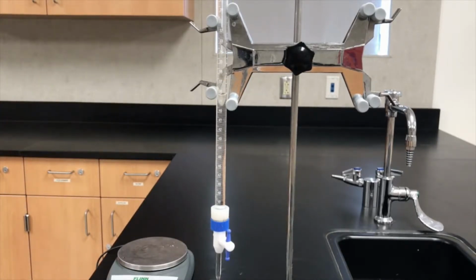All right, then I'm going to add my potassium permanganate. Now the reason why I need to add a little bit of potassium permanganate is because if I add potassium permanganate right now and use that as my titrant, my solution will actually be diluted, and I don't want it to be diluted. So by adding 2 5 ml volumes of potassium permanganate, I know that my solution is not diluted, that it has the same concentration as what I assumed its concentration was.